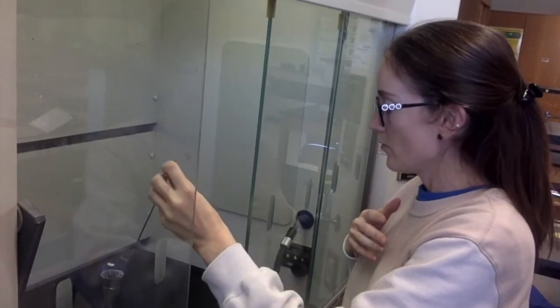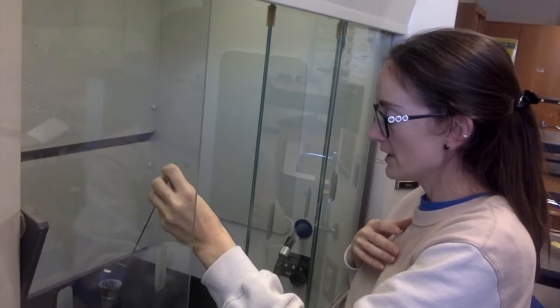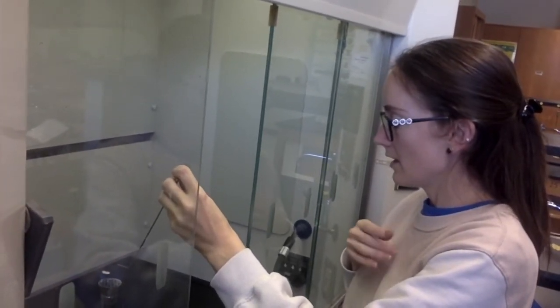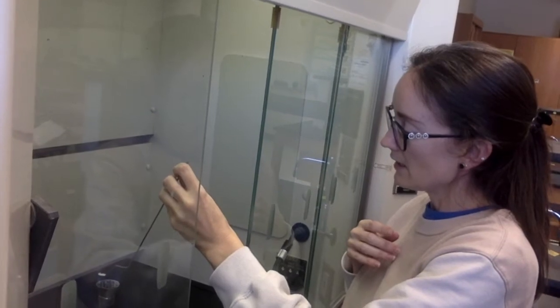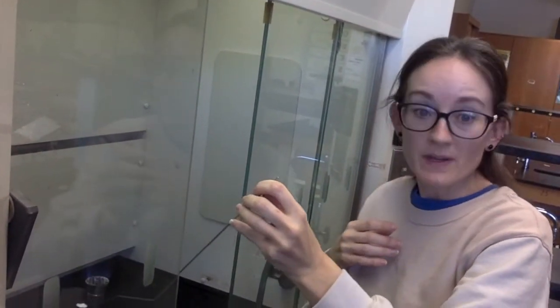Okay. 1, 2, 3, 4, 5, 6, 7, 8, 9, 10, 12, 13, 14, 17, 18, 19, 20. Okay, so I'm going to stop it at 20 seconds because it's still not melting.